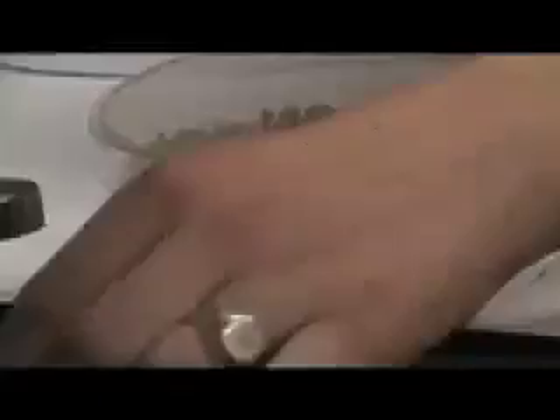You don't need to be that aggressive. Do you know which kind? It's stinky. Is that a male or a female? That's a male. He's coming out the side. Okay, close it. What is it? I think it's a female, but you look just in case. It's got the little X on its back. It's a little stinky. Can you turn it over? They do fly a little bit — Rosalyn corrected me. I've never seen them fly. I think it's a girl.